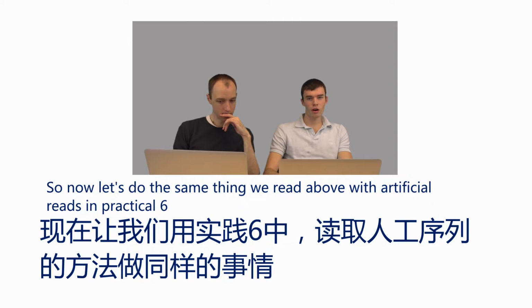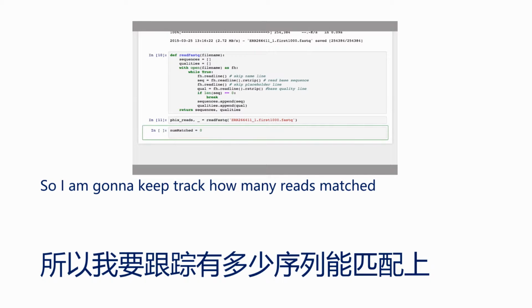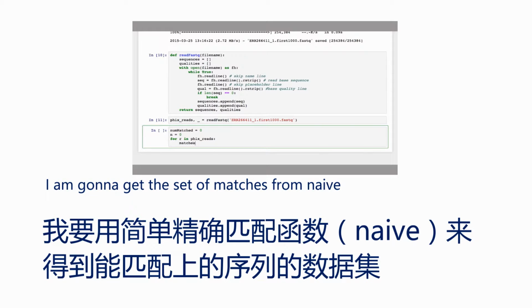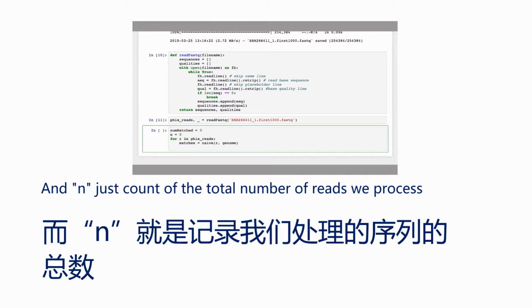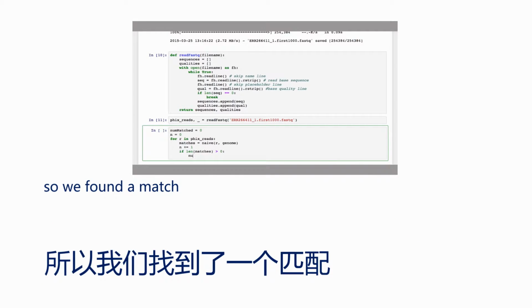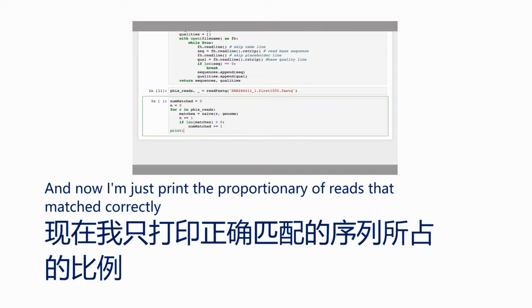So now let's do the same thing we did above with artificial reads, or in Practical 6, and actually align these against the genome and see how many of them match. So I'm going to keep track of how many reads have matched. Say for each read R in my list of reads, I'm going to get the set of matches from naive. And N is just a count of the total number of reads that we've processed. So now I can say if the length of the set of matches returned is greater than 0, that means that the read aligned in at least one place. So we found a match, so I can increment num matched. And now I'm just going to print the proportion of reads that match correctly.